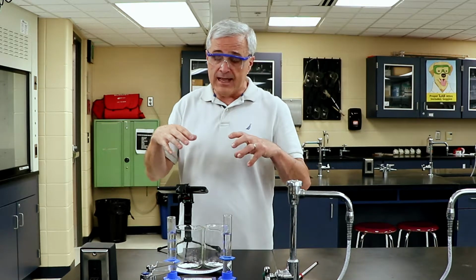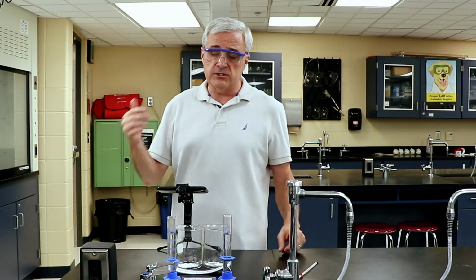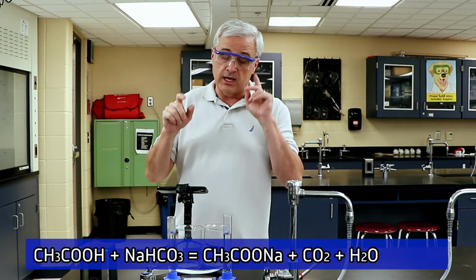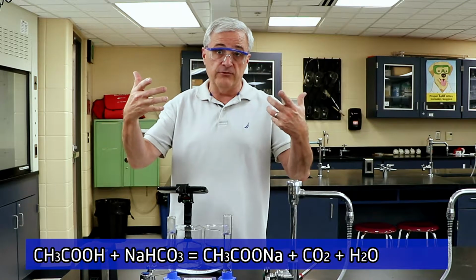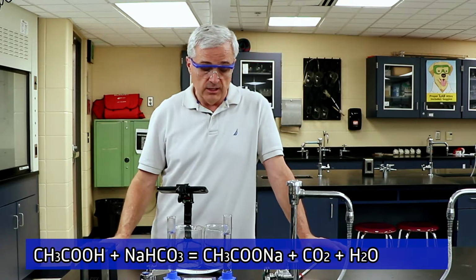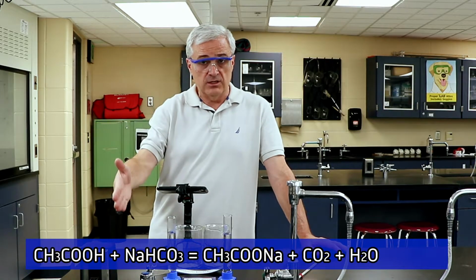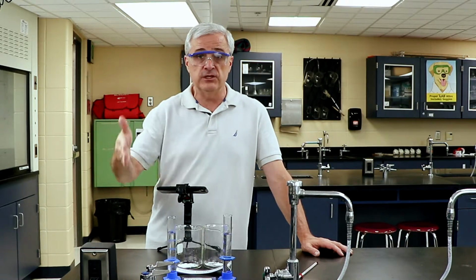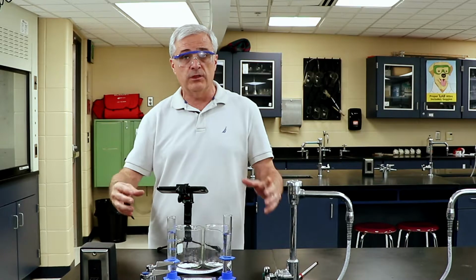We're going to let the reactants begin reacting, and the reaction of acetic acid and sodium bicarbonate forms carbon dioxide. Those bubbles are going to rise through the liquid and effervesce out of the surface of the reactant. We want to see that the one that goes fastest will finish first. It's just like a race, like a cross-country runner. The one who runs fastest finishes first, and the ones who run less quickly will finish later. So the reaction that stops first is the one that went fastest.